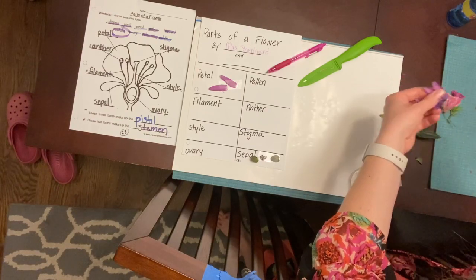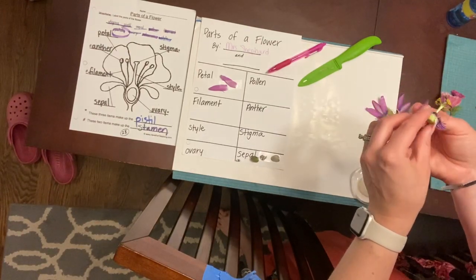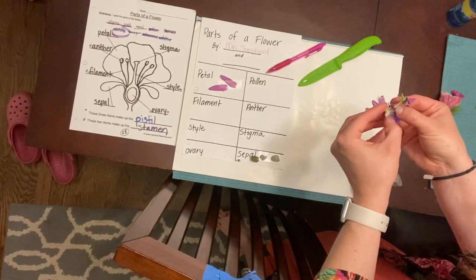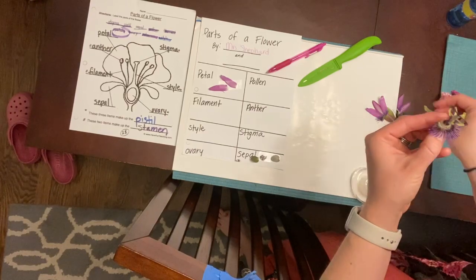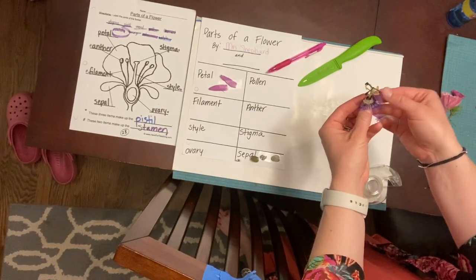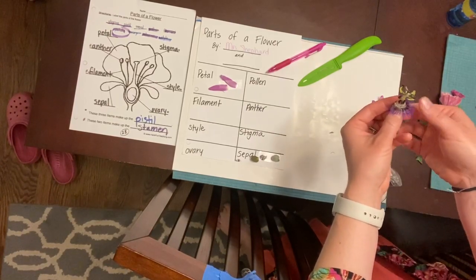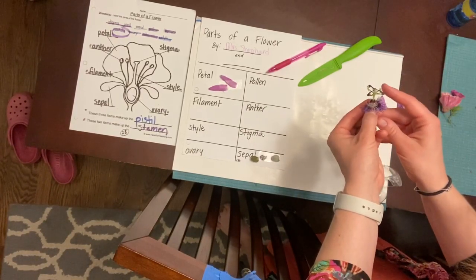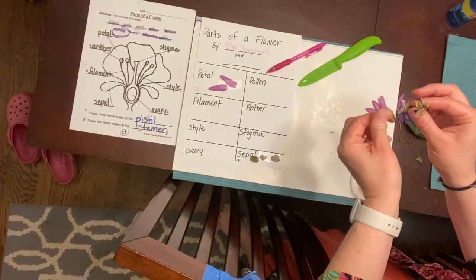Now, to be honest, boys and girls, I don't even know what this plant and this flower is called. It grows over my fence from my neighbors, okay? So I am not sure what all these little parts are. I don't know why they're important. They're certainly not the pistil or the stamen, because I can see those parts really easily over here. So I'm just gonna leave that be for now.